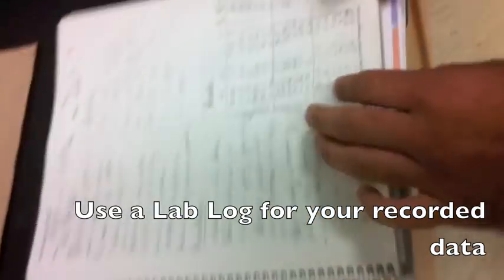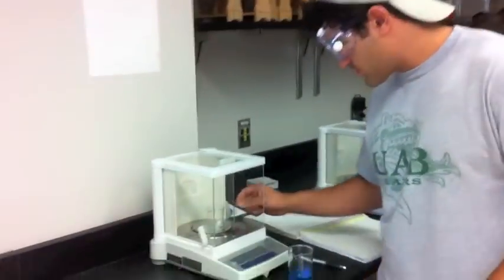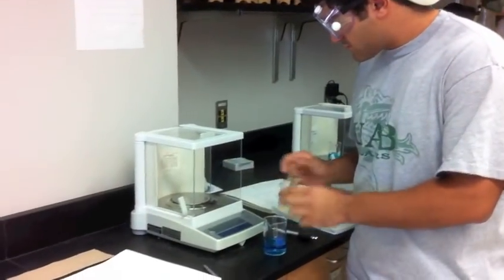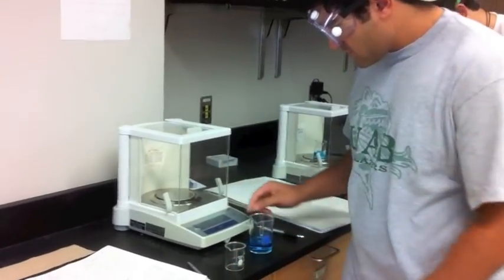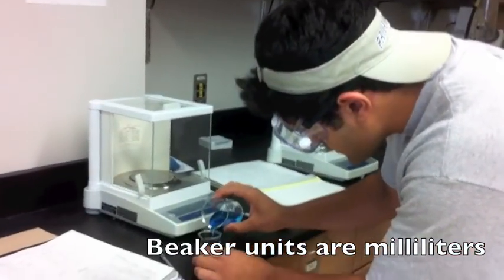Record the results under beaker, and you'll write 30.37. Come back and take it out. Make sure you tare it again before you start pouring this solution.